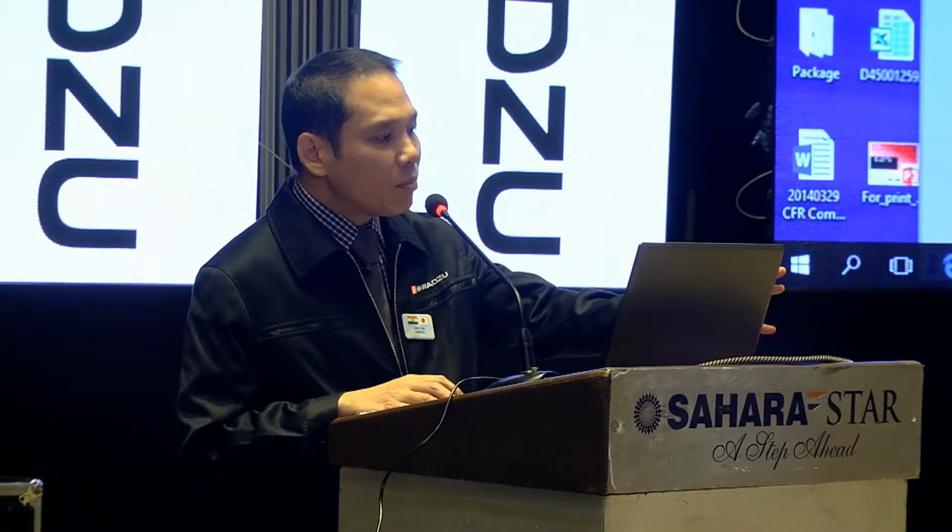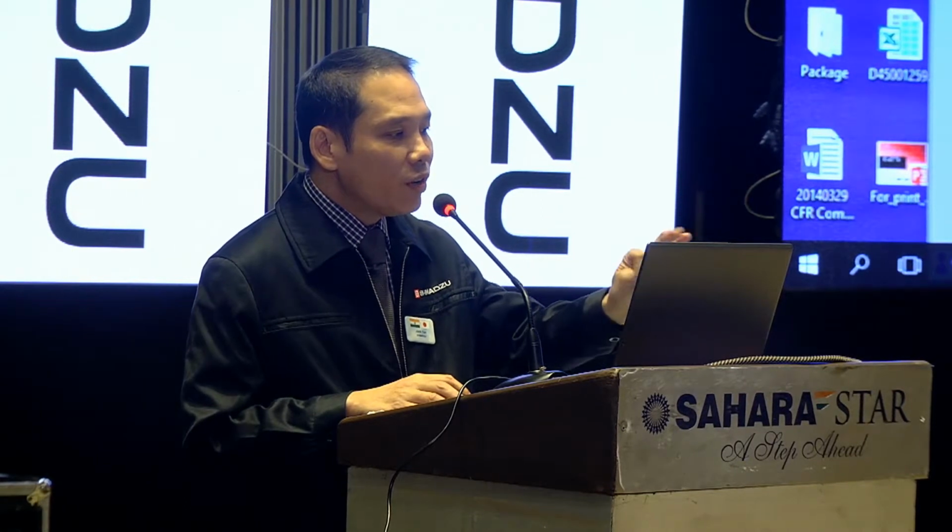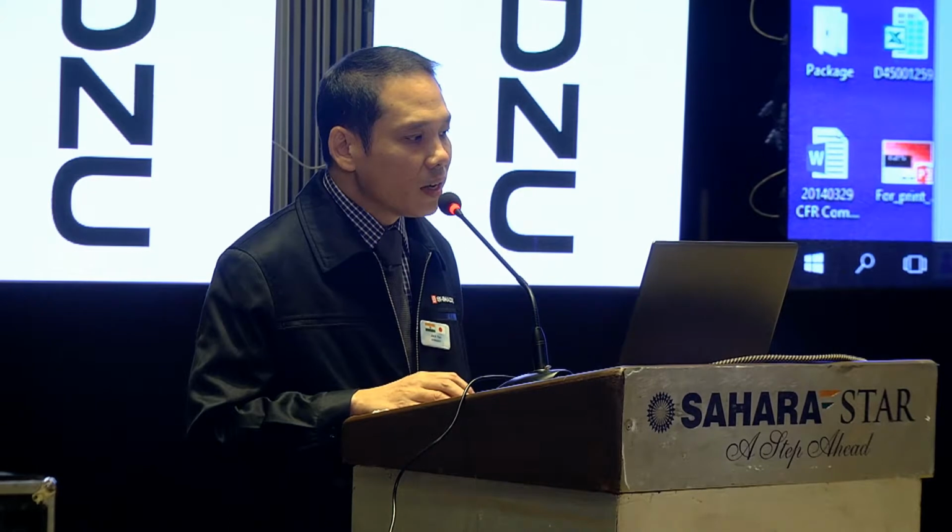So you can create, okay, so Sanjay's user permission doesn't allow me to add a new balance. So only create template and weigh. So when you click run, after you select the balance, you need to select the template file, which I've already created inside.